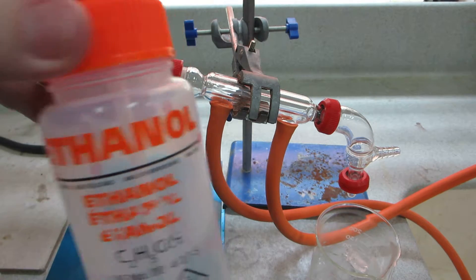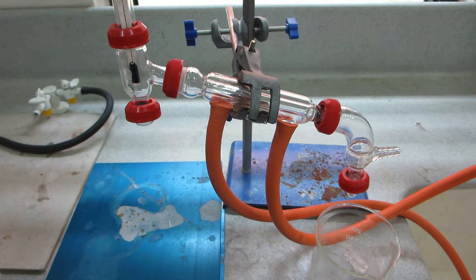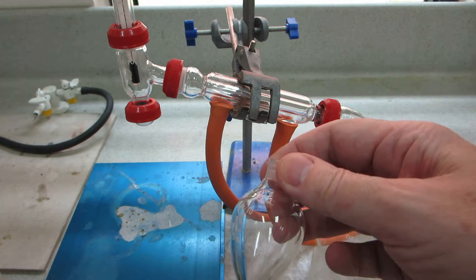This is the oxidation of ethanol using a solution of hydrogen peroxide and iron(II) sulfate that's been acidified with sulfuric acid.